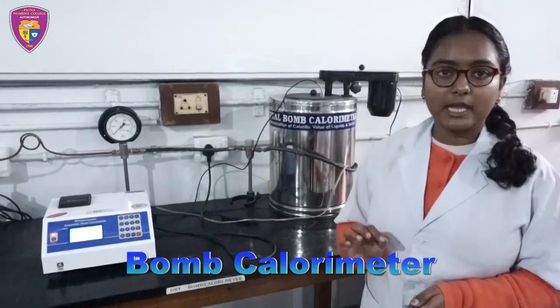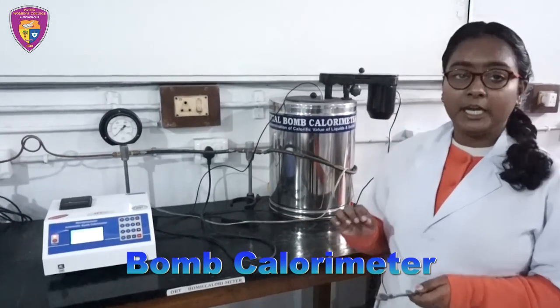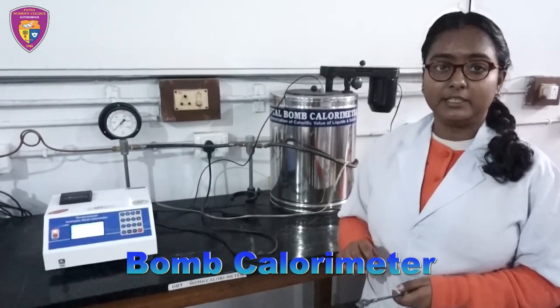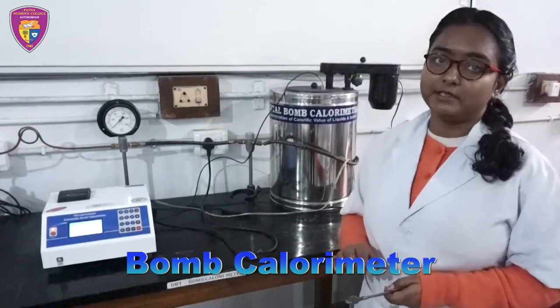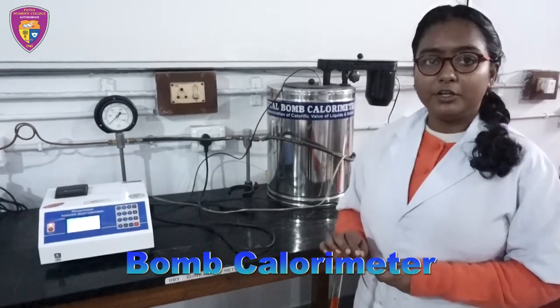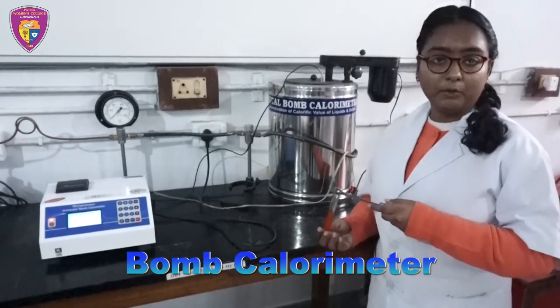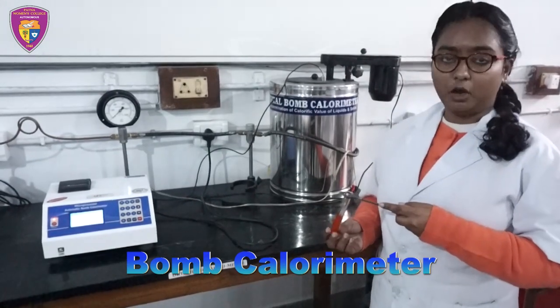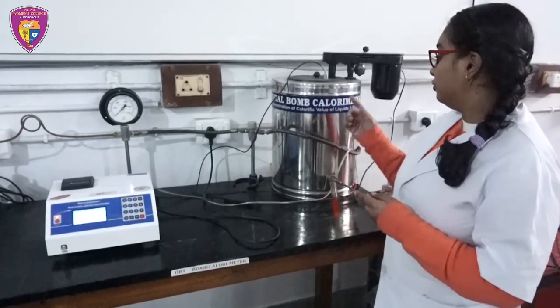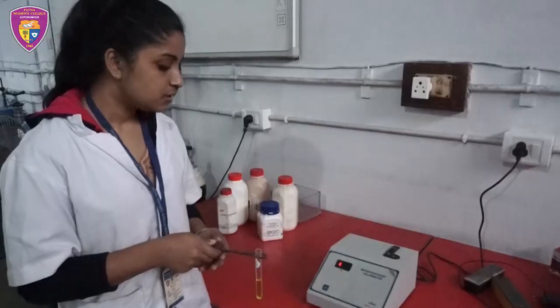This device is called a bomb calorimeter. It is used to measure the gross calorific value of solid and liquid samples. It is a constant volume type calorimeter that can measure the heat of a particular reaction or the calorific value of a fuel. Right now I am going to check the calorific value of this food sample through this bomb calorimeter.